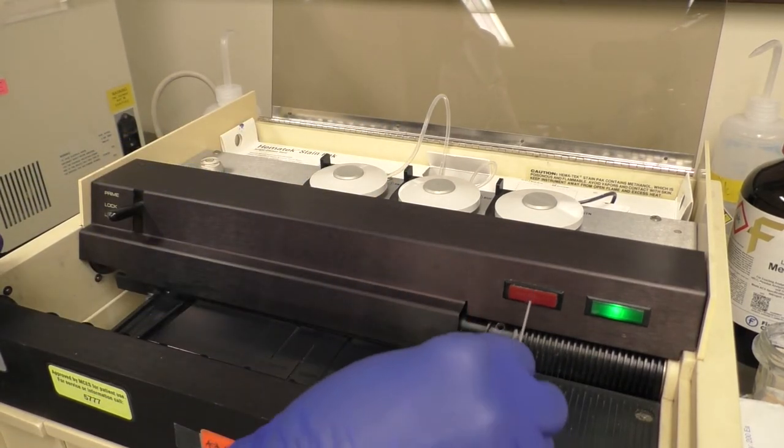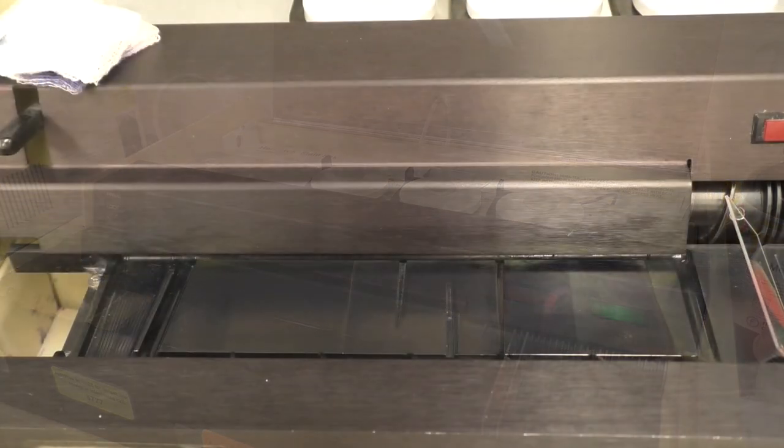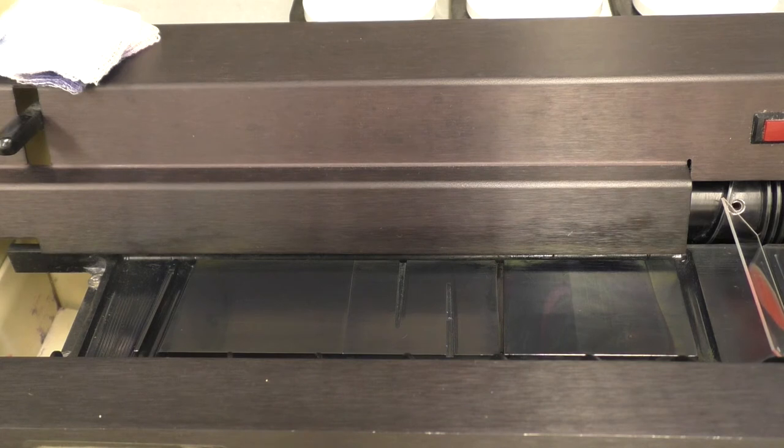The slides will now be conveyed along the platen for staining. The slide is advanced to a face down position upon the platen.